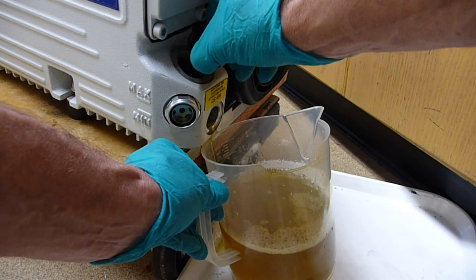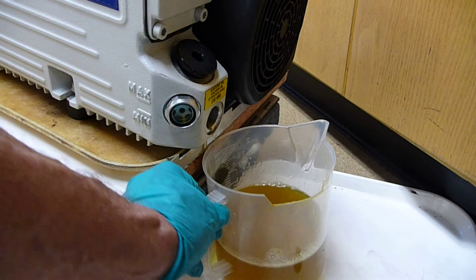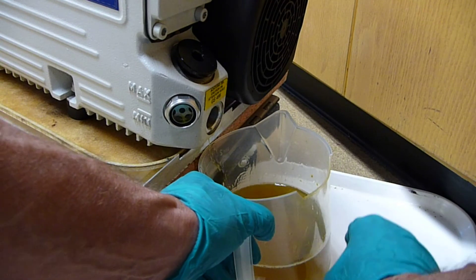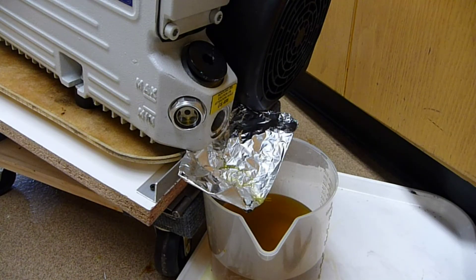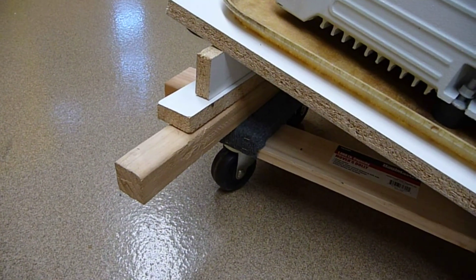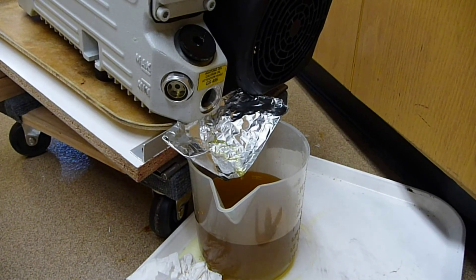Then I'm going to take the top off. The spout I'm going to turn. I've made an aluminum collar out of aluminum foil for the drip, so that's dripping. I'm going to let it drip out — I'll just let the oil drip out for roughly an hour.